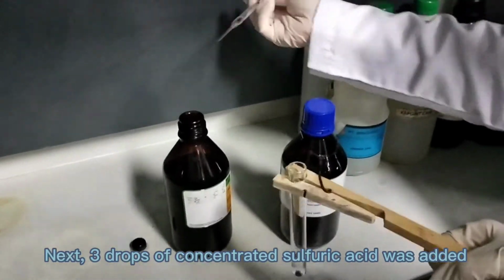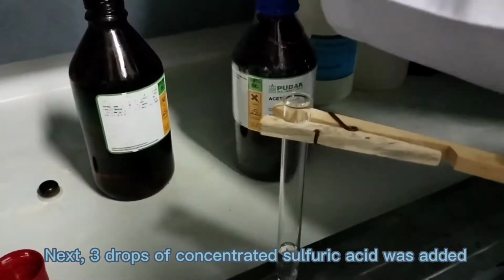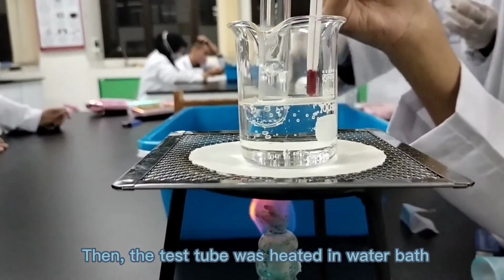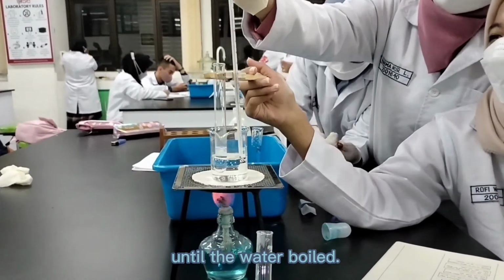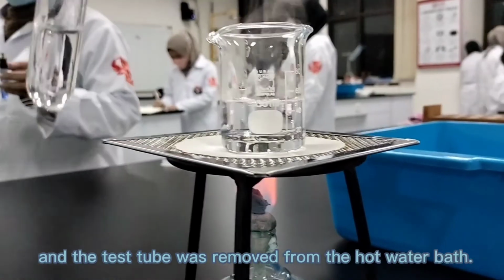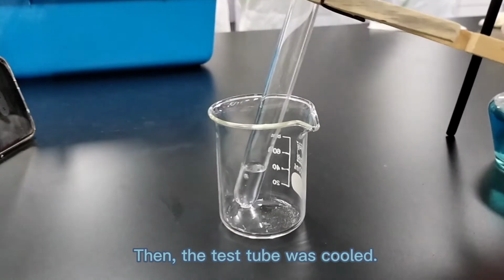Next, 3 drops of concentrated sulfuric acid was added and mixed in the test tube. Then the test tube was heated in a water bath until the water boiled. Next, the burner was turned off and the test tube was removed from the hot water bath. Then the test tube was cooled.